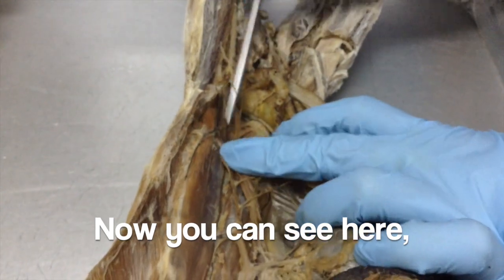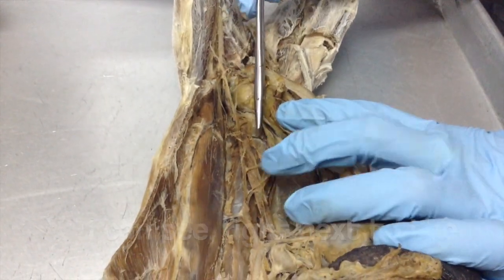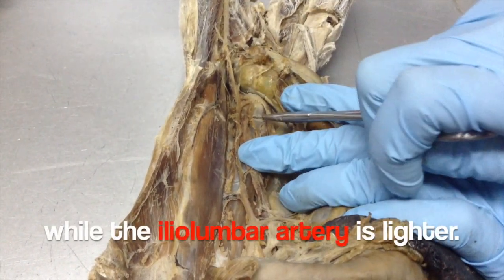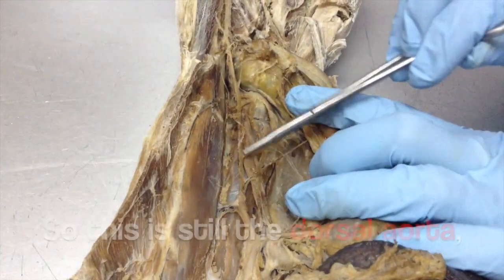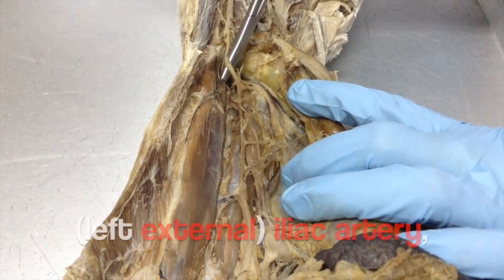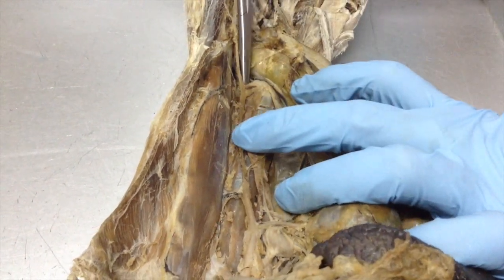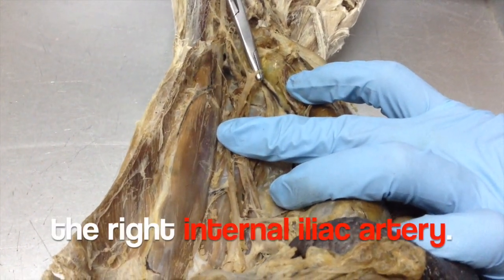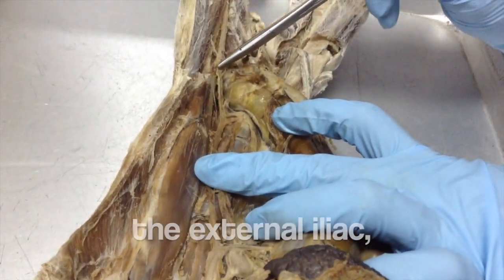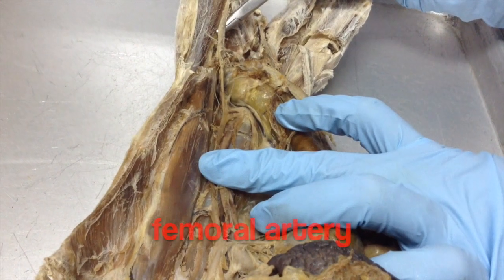You can see here the ilio-lumbar artery. This is still the aorta. This is the left external iliac artery. This is the right external iliac artery. And you can see here the right internal iliac artery. As you trace further posteriorly, the external iliac continues.